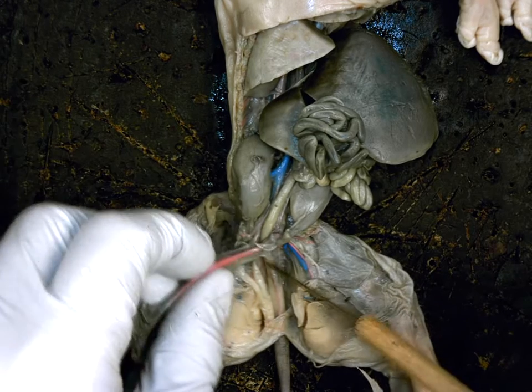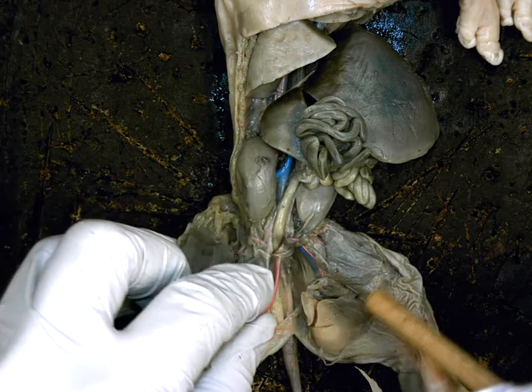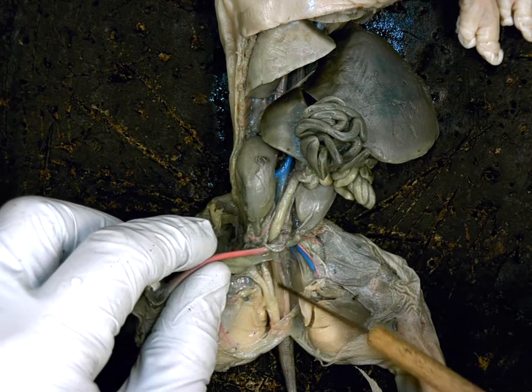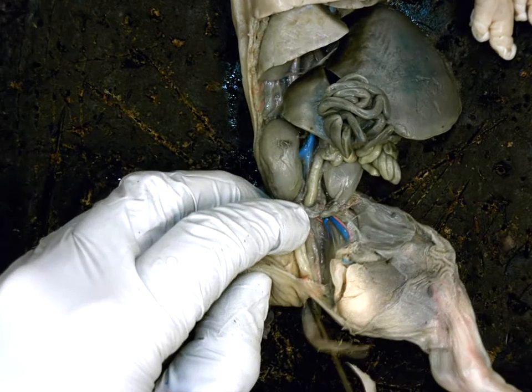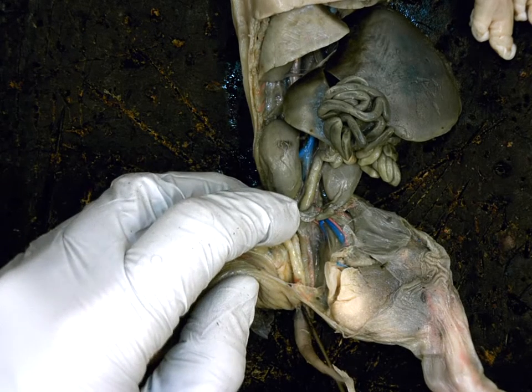Okay? Now under it, you're going to see this big tube here, right? If you go up and follow this tube, it's this one right here. What is this tube? That's still the what? The rectum, which is where the solid feces are being stored until it exits out. What? The anus, which is the tube that's the most posterior on the body.